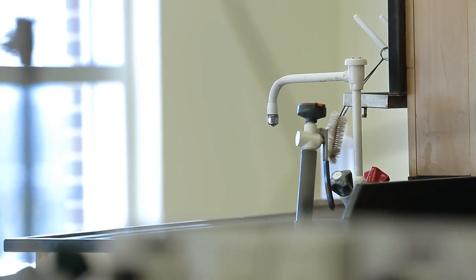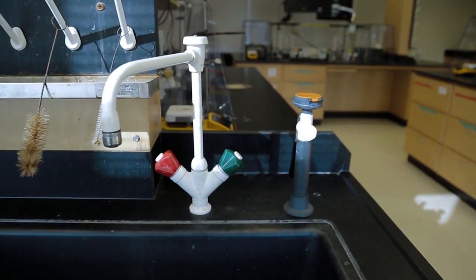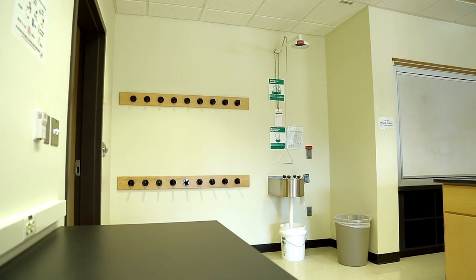For safety, each lab is equipped with two types of eyewash stations: eye soakers and a main eyewash station with a shower.